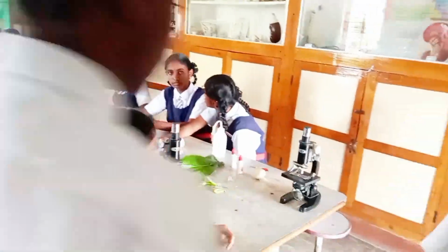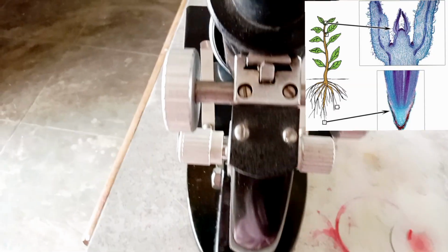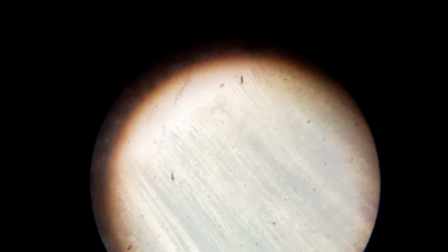My dear viewers, you too can watch these wonderful microscopic visuals which I made. These are meristems in onion root tips. You can see that these cells in meristematic tissue are elongated in nature and these are undergoing rapid cell division. This is the tissue in apical meristems in the shoot tip, that means stem tips. Cells in meristems do not spend much time in G0 phase, that is gap 0 phase, and immediately enter into the next cell division so that these cells have an elongated appearance.